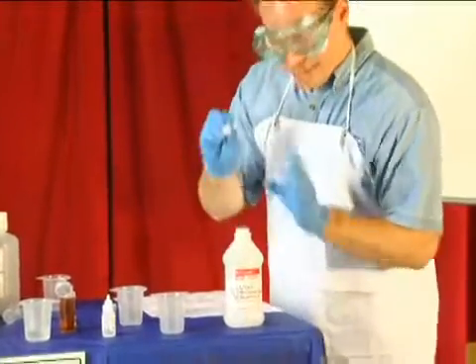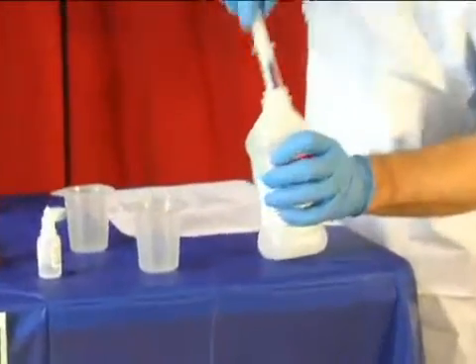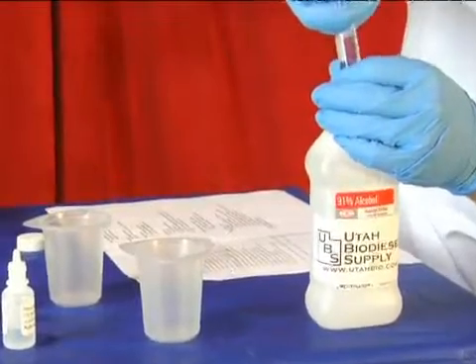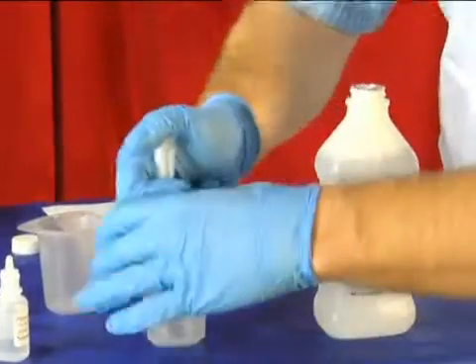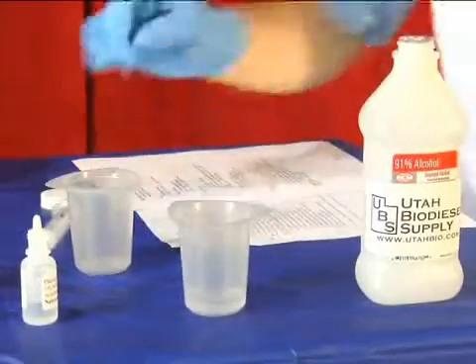We're going to first of all add 10 milliliters of isopropyl alcohol to a vessel. I've got this measured up to 10 right here, so I've got 10 milliliters of isopropyl alcohol.